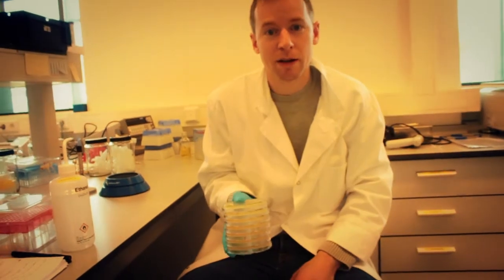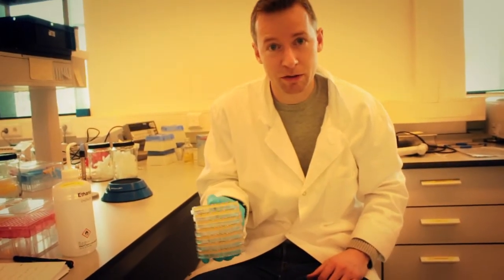And now we'll put them in the incubator at 37 degrees and tomorrow we'll see if we have some results.